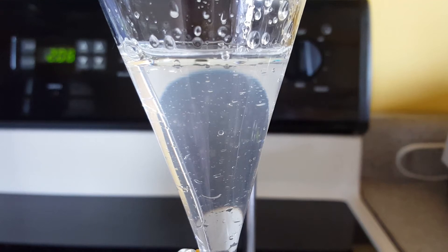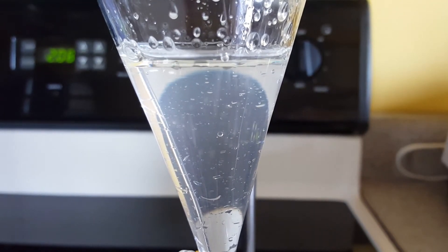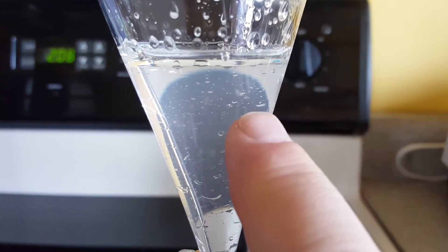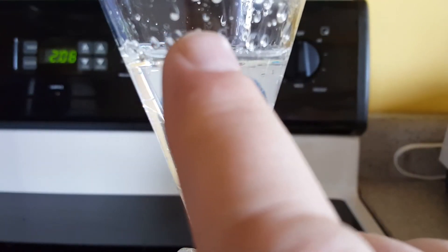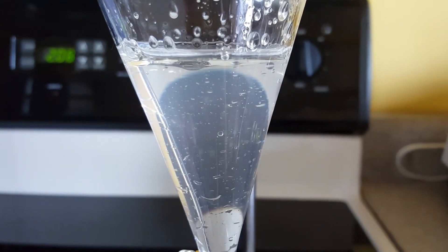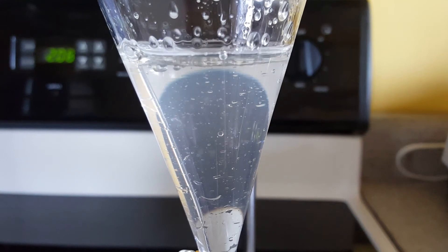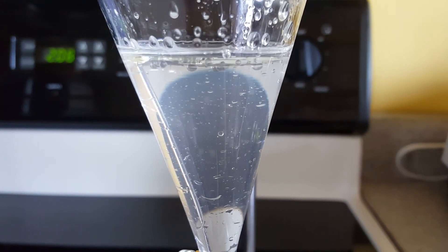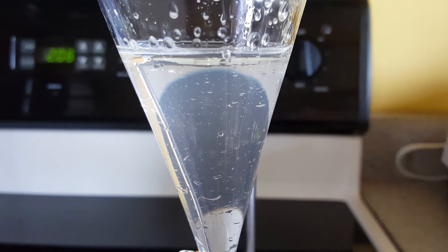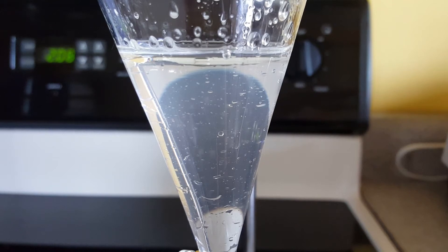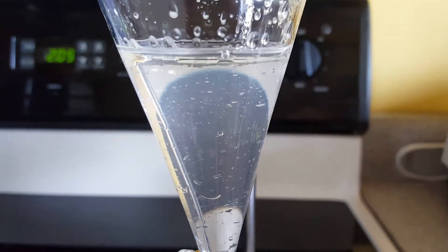One other thing that I've noticed is that you can see these little bubbles here on the walls and also these droplets above the liquid. No matter what I do some of these bubbles or droplets will not incorporate neither into the water phase or the oil phase, which makes me think that this may be an oil that has an even lower boiling temperature or solidifying temperature and it doesn't mix with the liquid oil on top of the water.